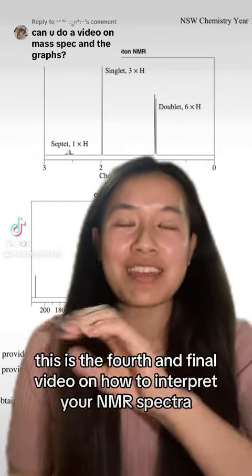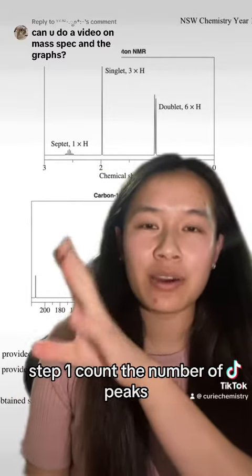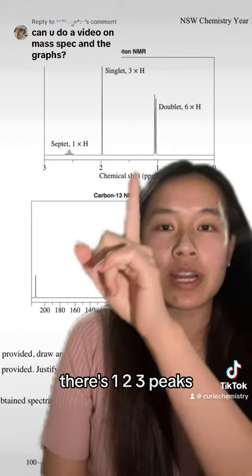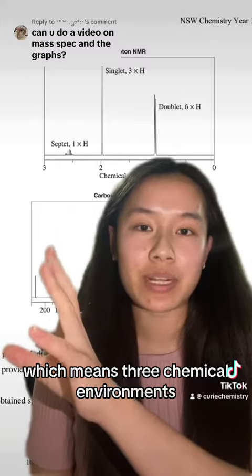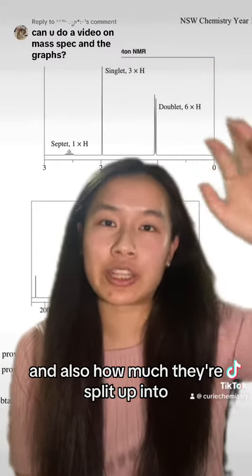This is the fourth and final video on how to interpret your NMR spectra. Step 1, count the number of peaks so that you know how many chemical environments there are. There's 1, 2, 3 peaks, which means 3 chemical environments. Step 2 is to look at how high the peaks are integrated and also how much they're split up into.